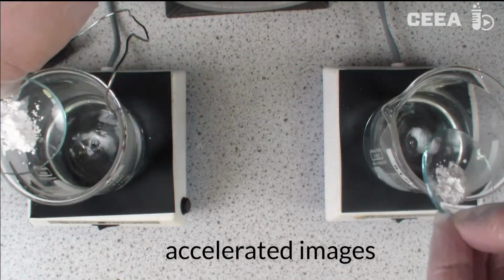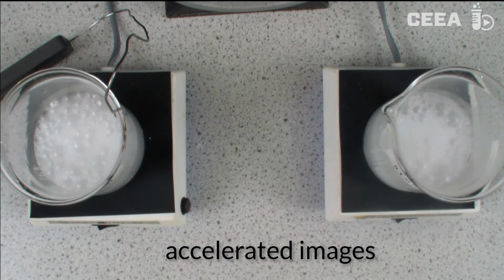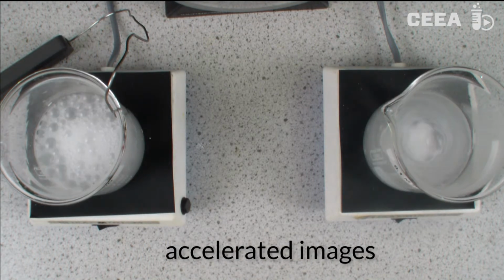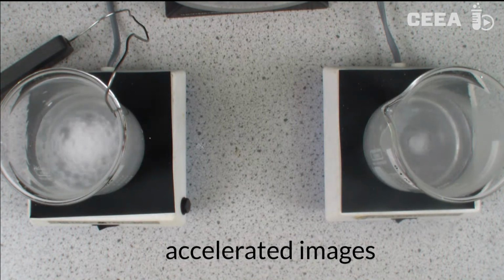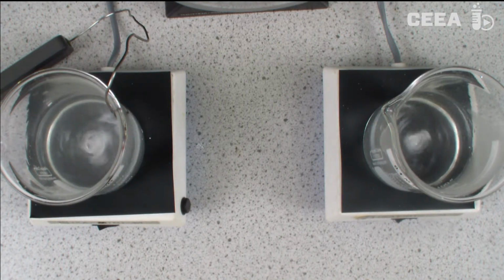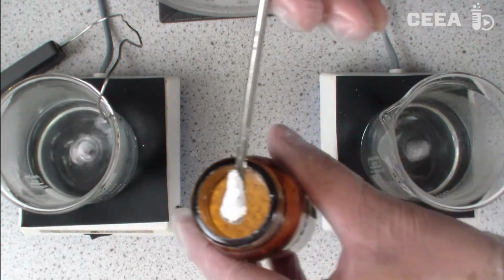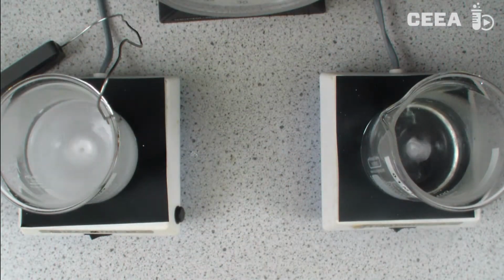And next we see the reactions from a top view. From the experiments, it can be concluded that reaction rates with acetic acid solution are lower than with hydrochloric acid, the difference amounting roughly to a factor of 2. At elevated temperature, the reactions proceed somewhat faster.